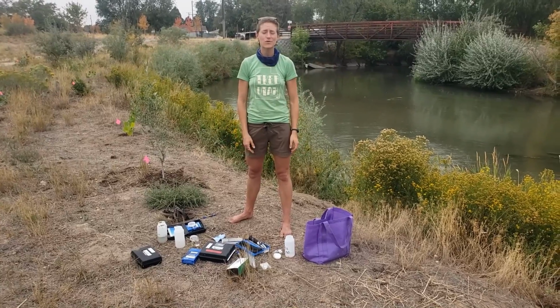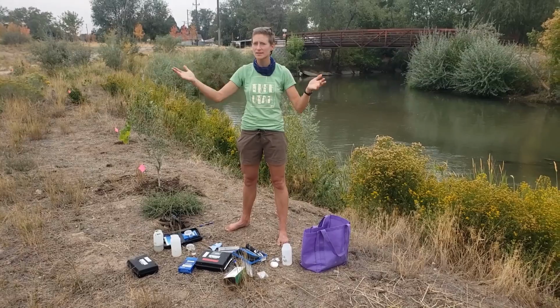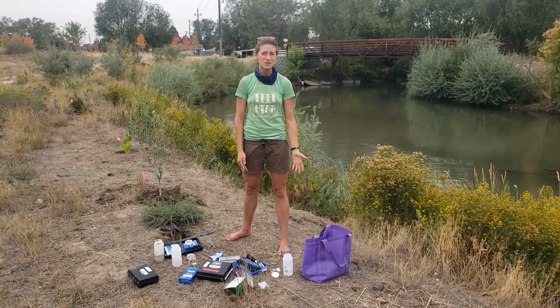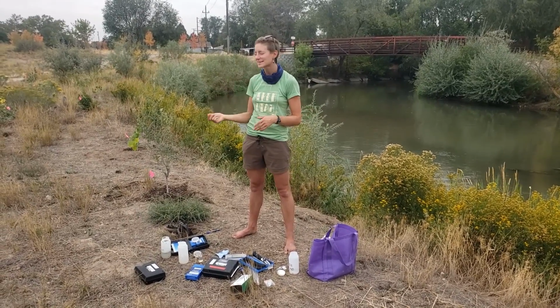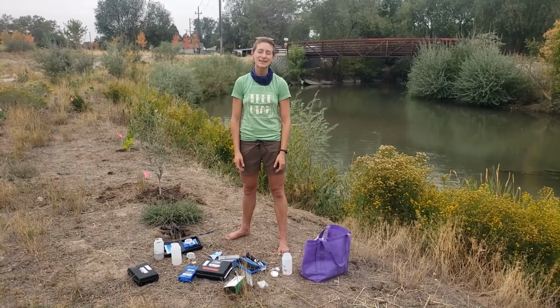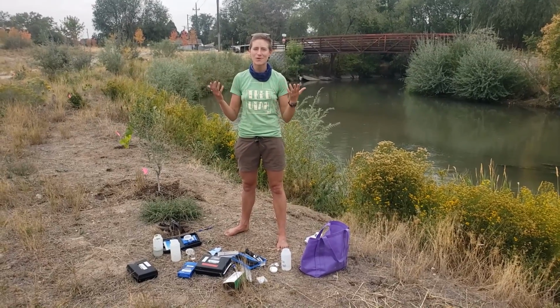Awesome. Well, we learned so much today. We measured 2 different bodies of water, a river and a pond. We learned how to measure for nitrogen, phosphorus, dissolved oxygen, temperature. Come out with us and do it yourself. Get your hands messy, learn something new, get off the screens, and join us out here. We'll be out here tomorrow, but check the site for any other activities that we do, and I hope you'll join us to learn more about water.